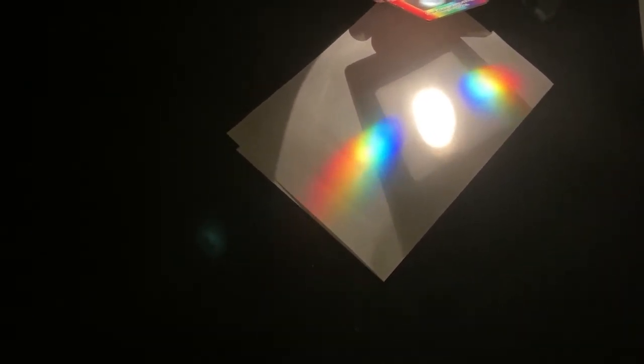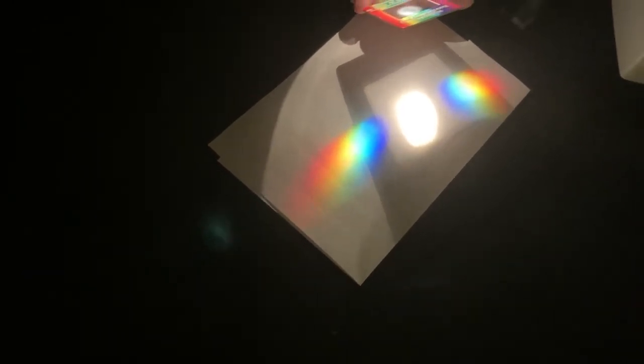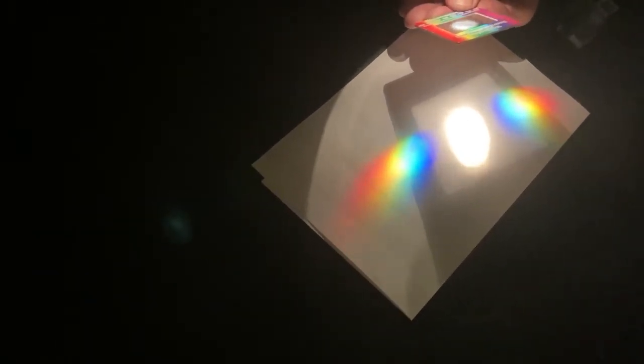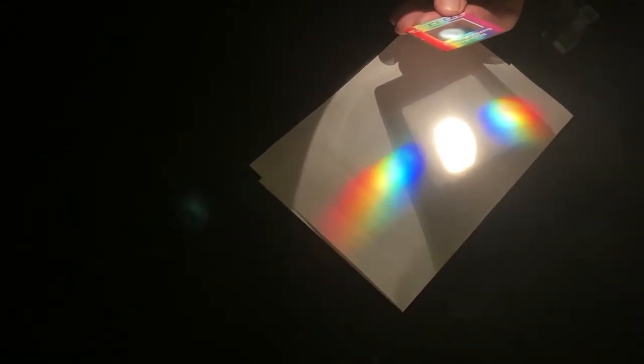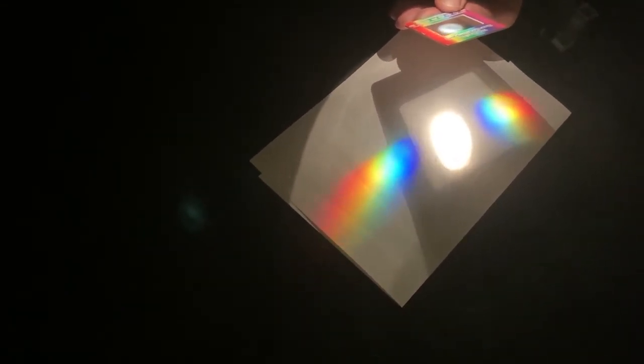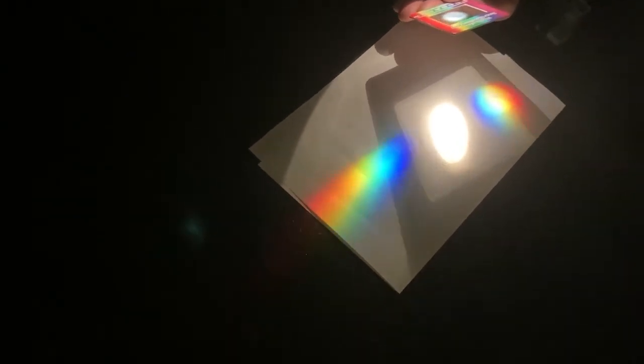I notice that there's an order there of the colors. Yeah, there is. And it's the same on both sides. We get the same effect on both sides. So, let's see. Red, orange, yellow, not much yellow, green, blue. Ooh, and then the other side of blue, there's really a dark blue. We could call that violet.